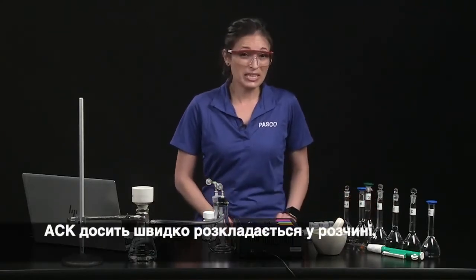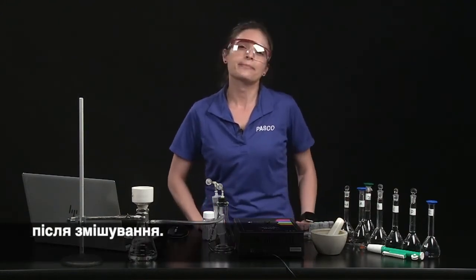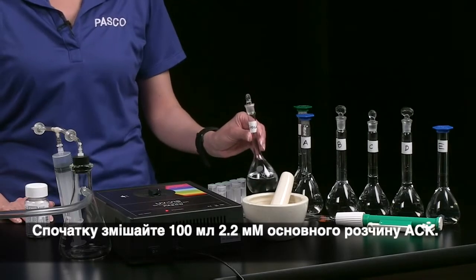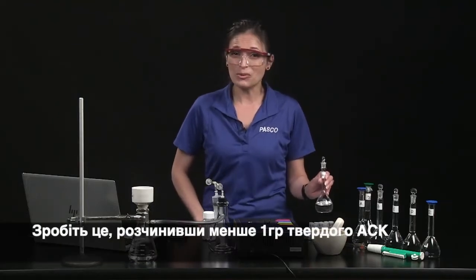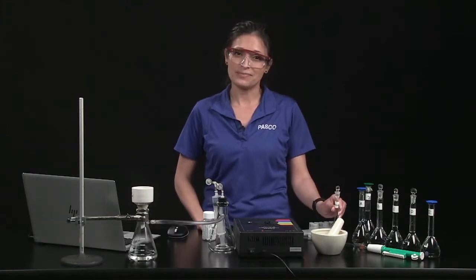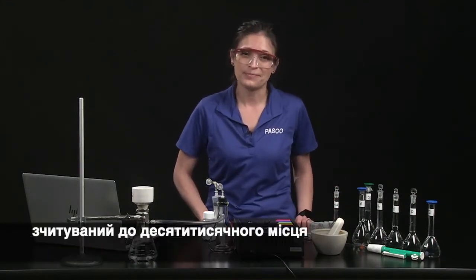ASA degrades fairly quickly in solution, so all solutions should be used within an hour or so of mixing. First, mix 100 milliliters of a 2.2 millimolar stock ASA solution. Make this by dissolving less than a gram of solid ASA in 95% ethanol in a volumetric flask. So you will need an analytical balance readable to the 10,000th place.